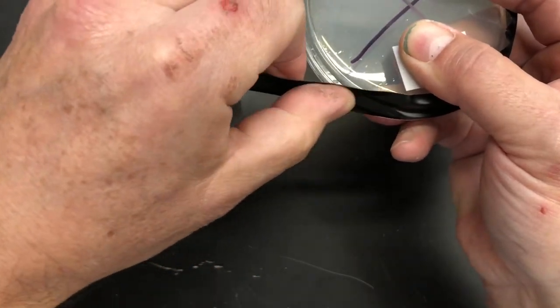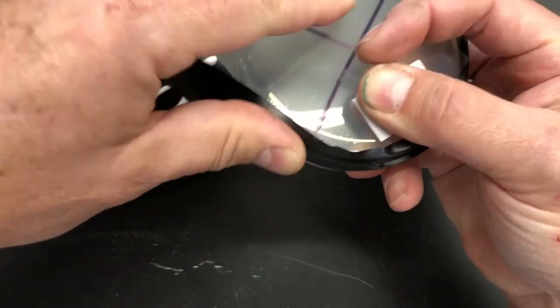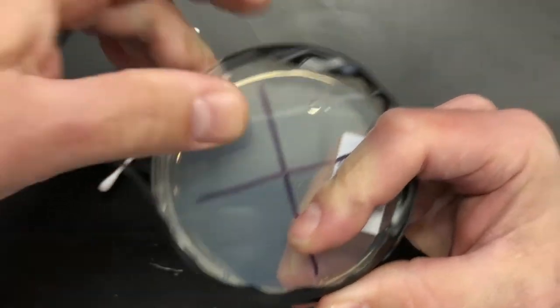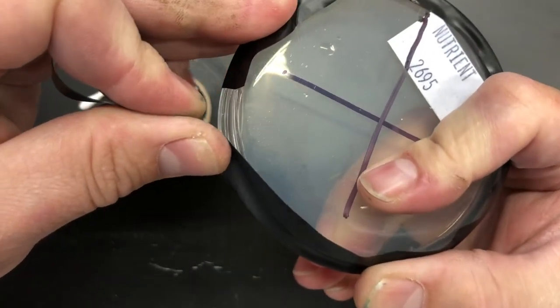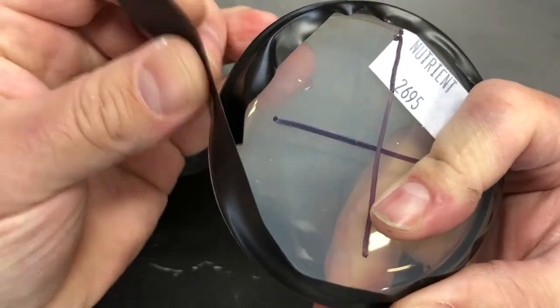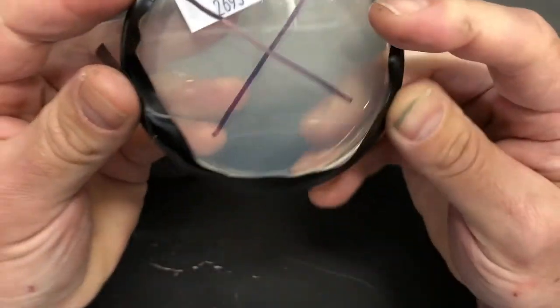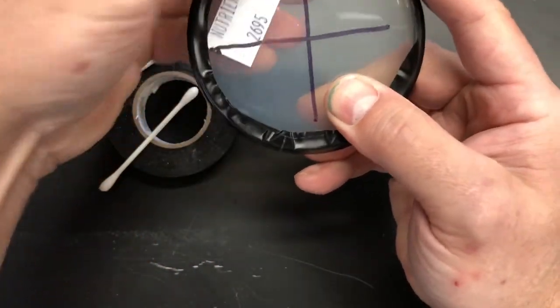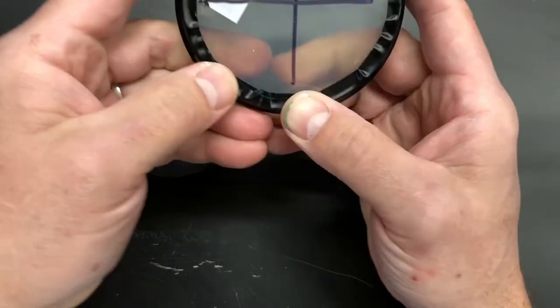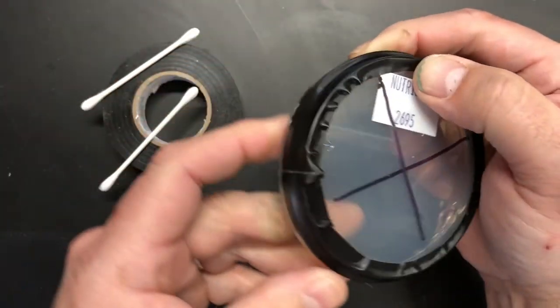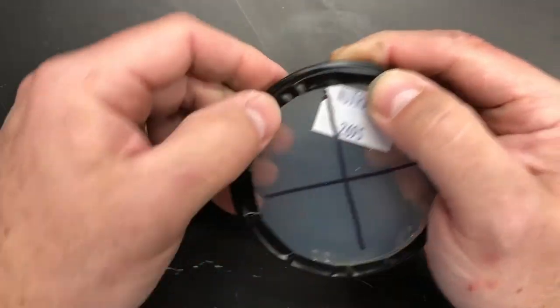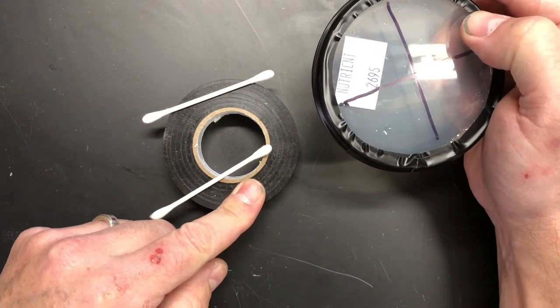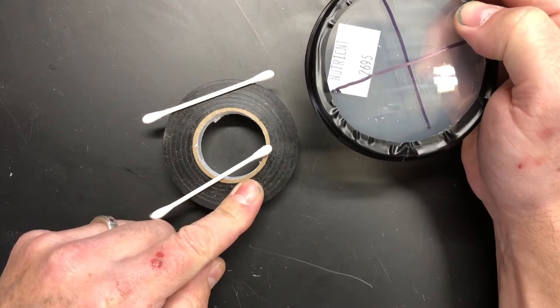If you get a wrinkle like that, just pull it a little bit more. This is why we use electrical tape, because we want it to stretch, and you're not gonna get that with duct tape or masking tape or even clear cellophane tape. We have to use something stretchy. Alright, now we can make sure that that's good and sealed like that. One foot of tape is more than enough. You saw that I had quite a bit of overlap. So one roll of this tape should get you through five classes, full-size classes easily if you're doing groups of four.